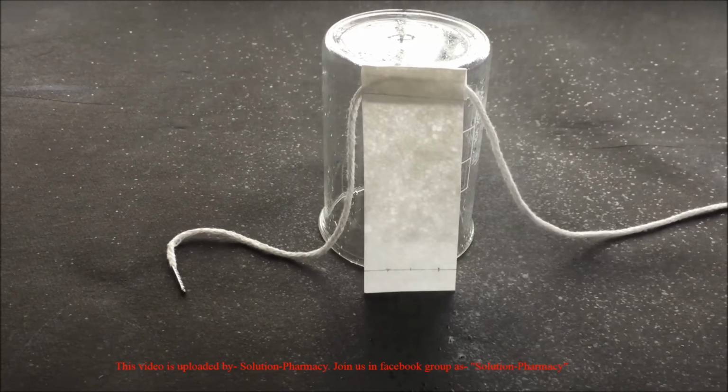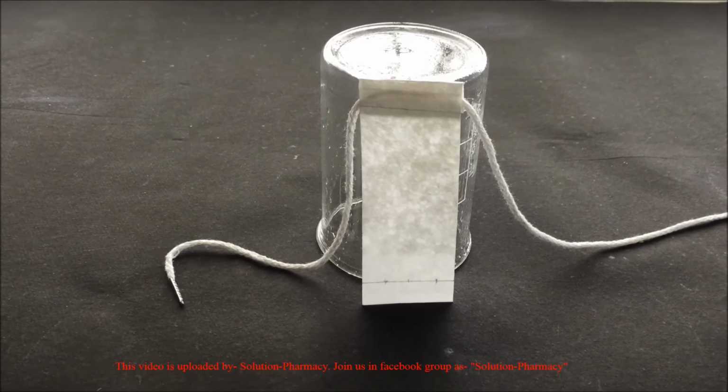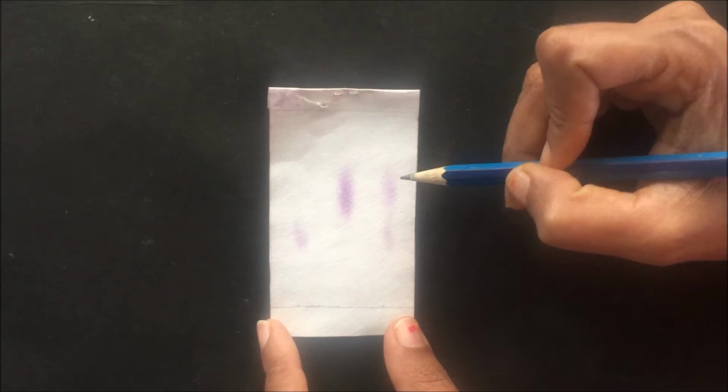Spray the filter paper with the ninhydrin reagent, and after spraying, dry the filter paper in a hot air oven at 100 degrees Celsius for about 5 to 10 minutes. Ninhydrin reacts with amino acids to give a bluish violet color. After drying in the hot air oven, you can see the bluish violet spots of amino acids. After this, outline each spot of amino acids on the filter paper with a pencil and mark the center of each spot.